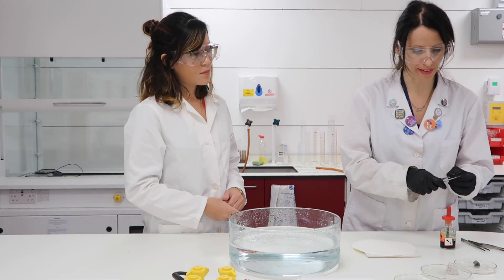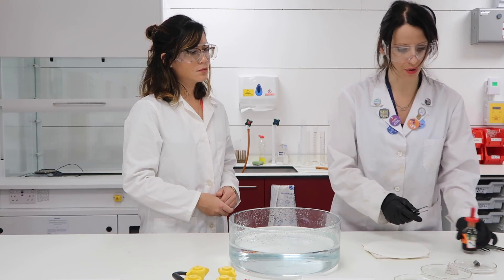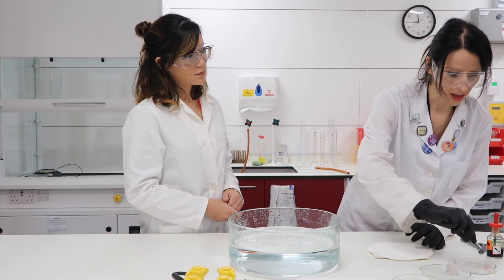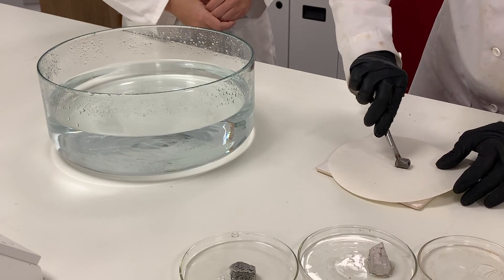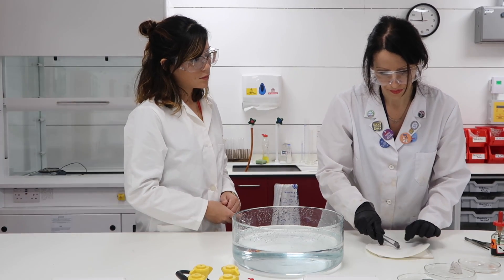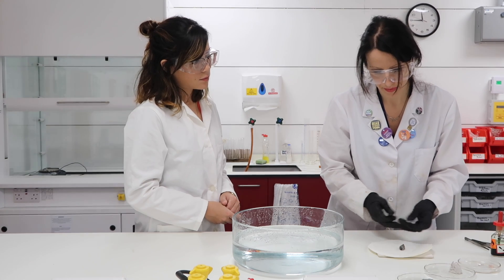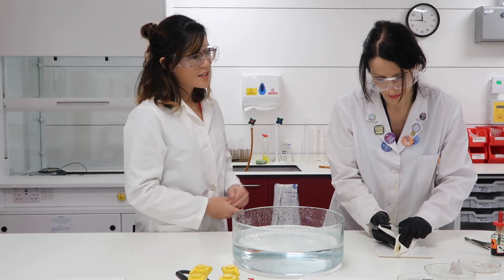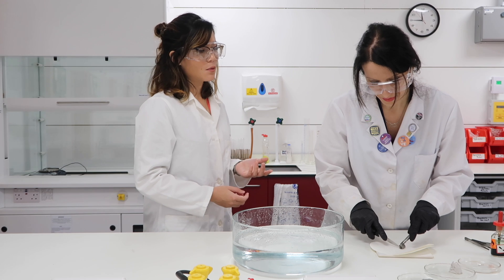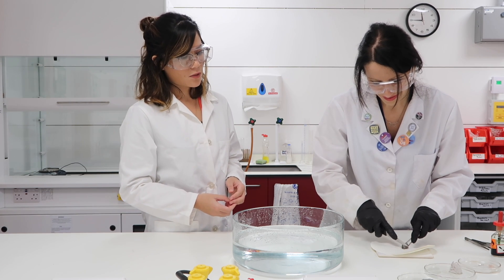So I'm going to take the lithium, and because they are stored in paraffin oil for safety reasons, I will remove all the oil on filtering paper like this. I'm going to cut a little piece now. And this is extraordinary — when would you ever say you're going to cut a metal with a knife? This is characteristic of Group 1 metals: they're very soft.